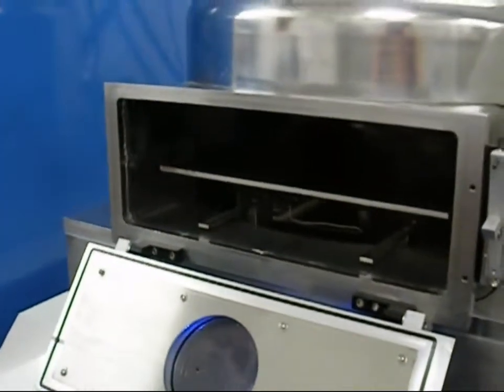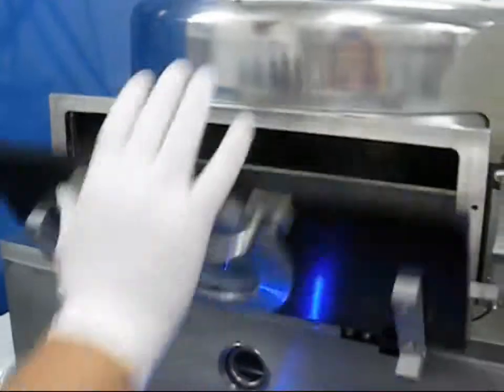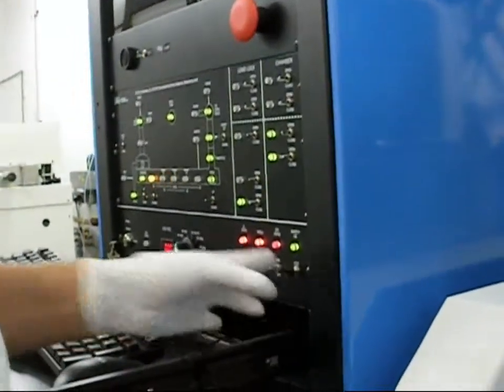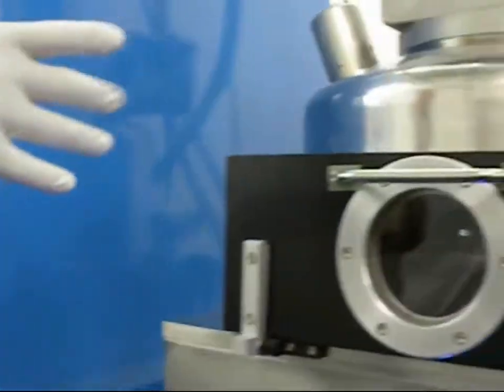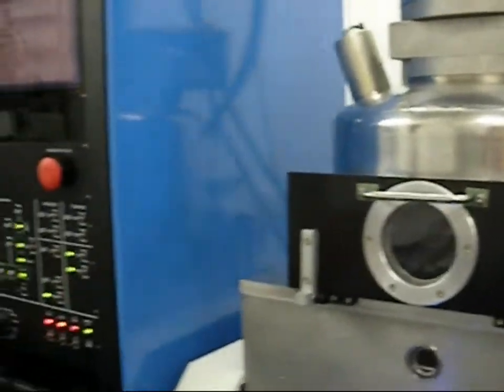To initiate a pre-programmed automatic thin film sputtering process recipe, the operator loads a substrate pallet onto the upper level of the 2-level load lock elevator. The operator then closes the load lock access door and depresses the Good to Go button located on the diagnostic maintenance panel.